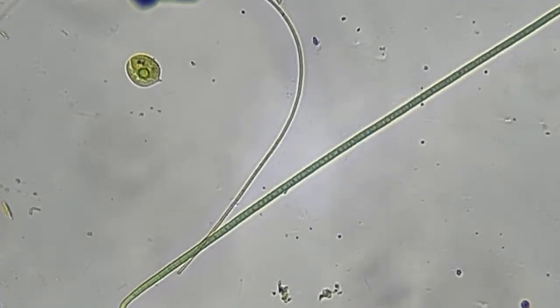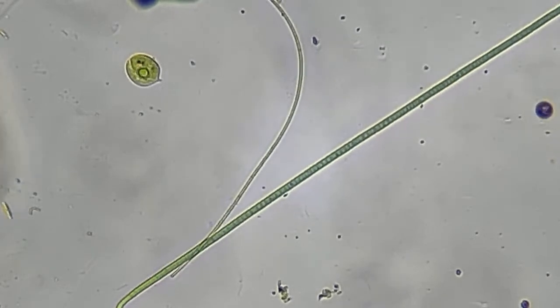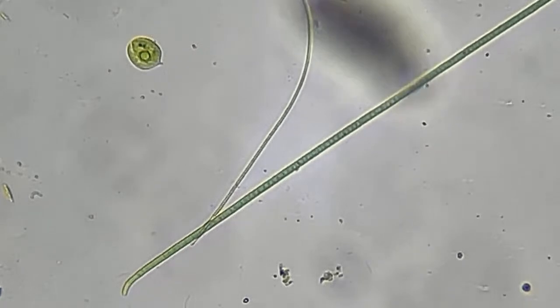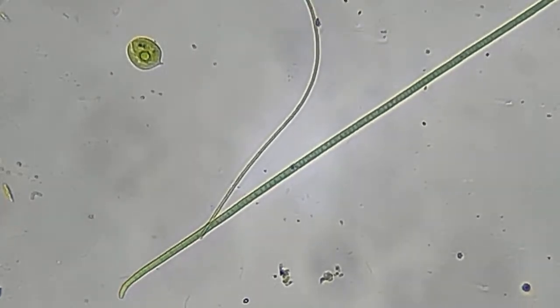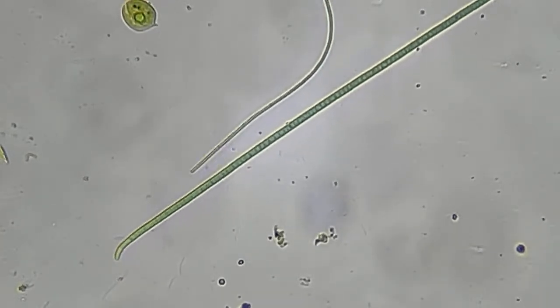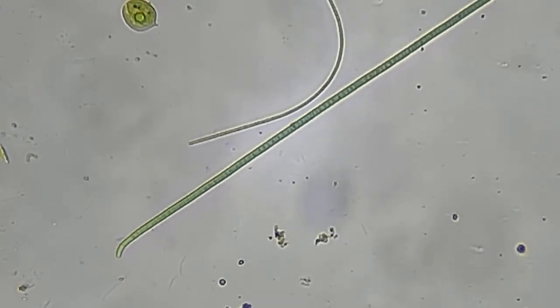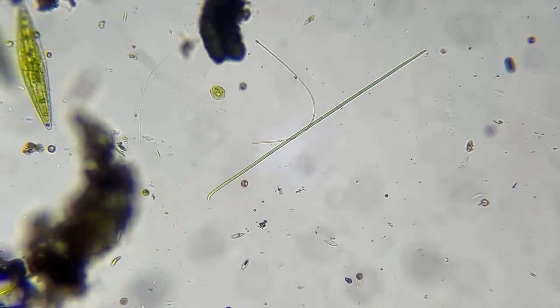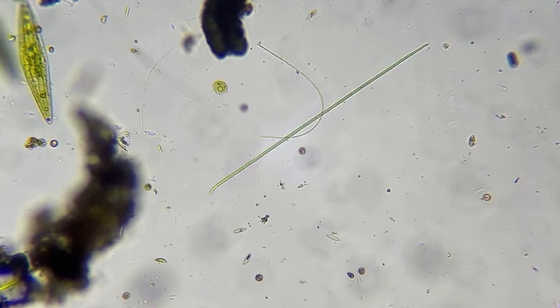Digital zoom gets a little grainy, but if you look, you can see each nucleus of each chloroplast, if I'm saying that right. I may be able to go up to 400. Let me try my big gun here and see what we can see.